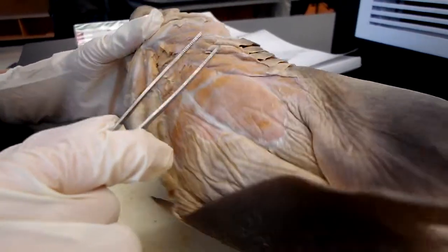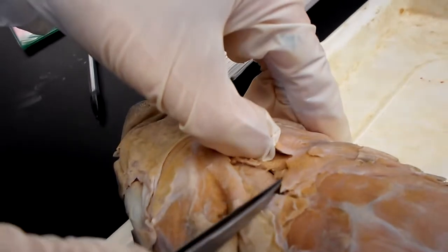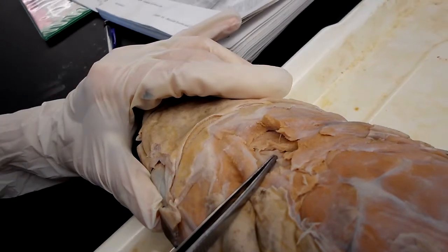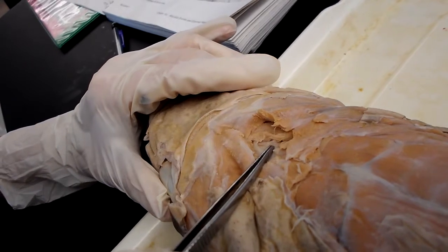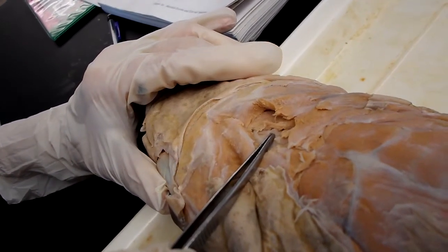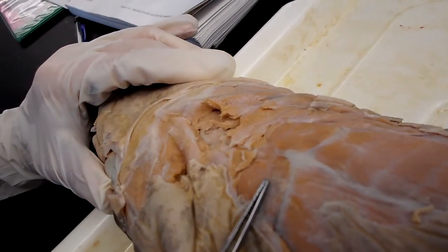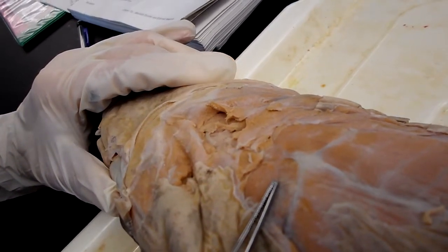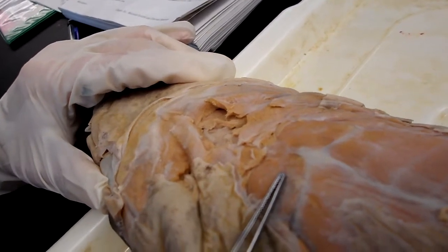And then the coracomandibularis is on the inside, that muscle on the inside. It originates at the fascia of the coracoarcual muscle and inserts into Meckel's cartilage, and is homologous to the geniohyoid. And then the coracoarcuals are this one, and they originate at the coracoid bar and insert into the coracohyoid muscle, and are homologous to the pectoris scapularis and rectus cervicis.